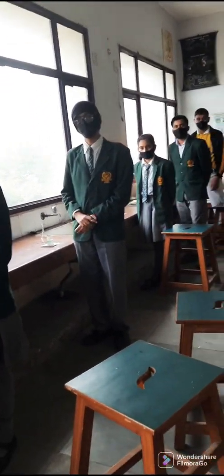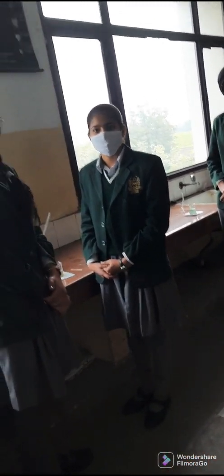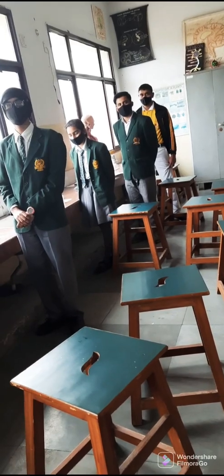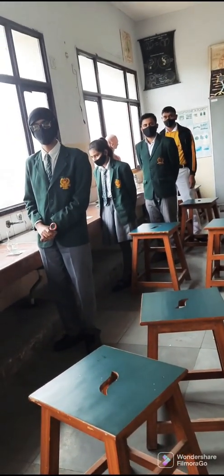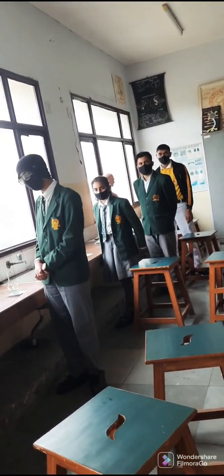So the students took soil samples from near roots, from a crop field, from the roadside, and from a ground area. Out of all of these, the soil near roots has the best water holding capacity. The ground soil is sandy in nature with bigger particle size, so its water holding capacity is least. The crop field soil is similar to the near-roots soil, while the roadside soil has the least capacity, comparable to the ground soil.